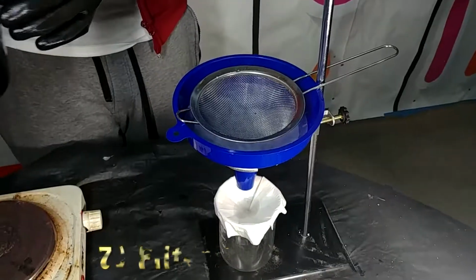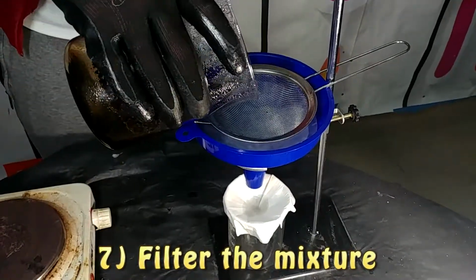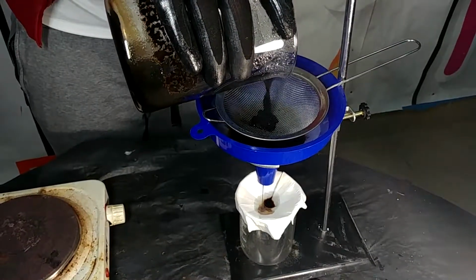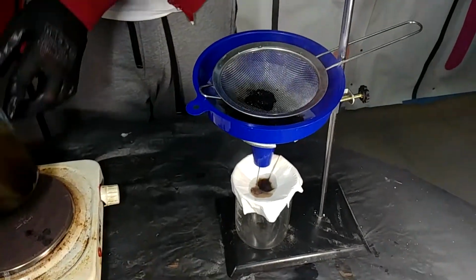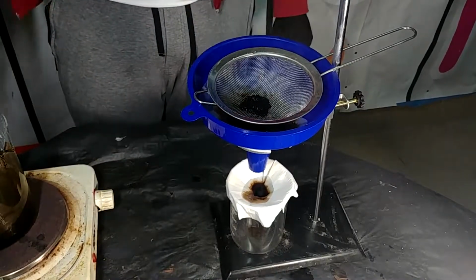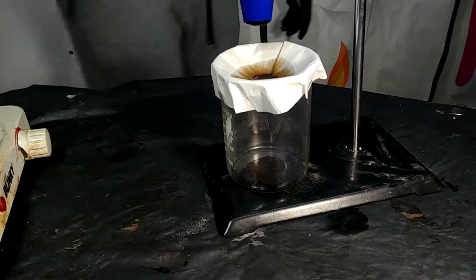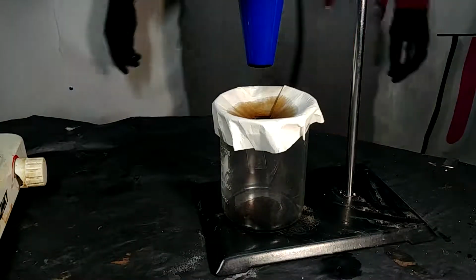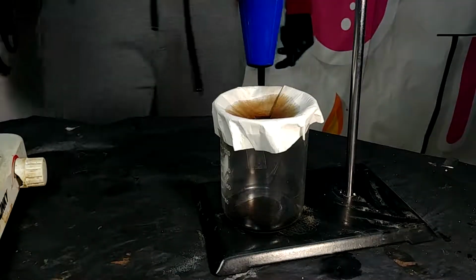So the last thing that we are going to do in our solubilization part is to filter this liquid in order to remove any trace of coffee from it. In this experiment, the filtration step is the most difficult step, and that's why we have adopted a particular method to do this. In fact, it consists of two particular steps.